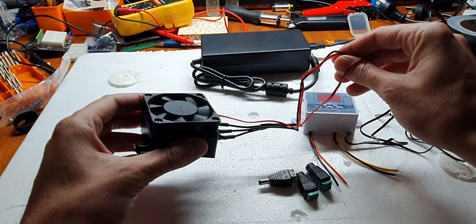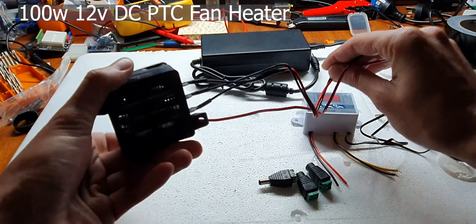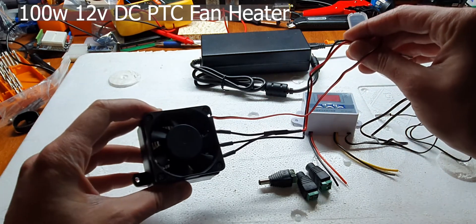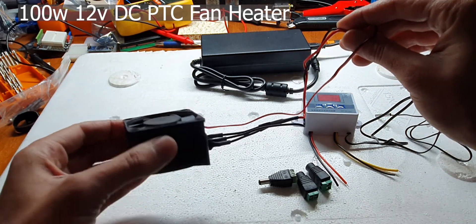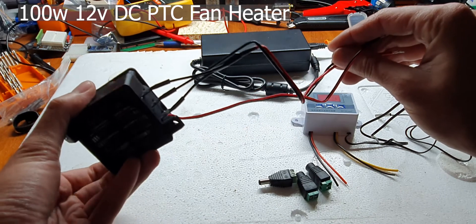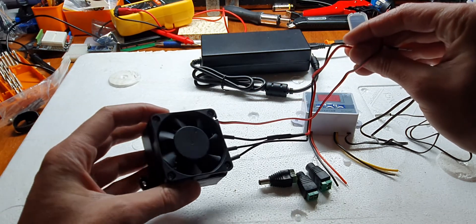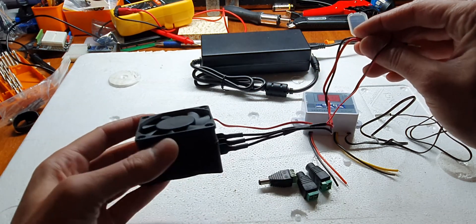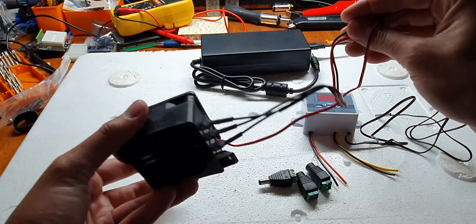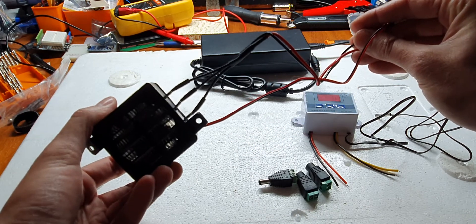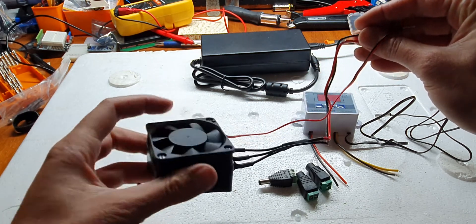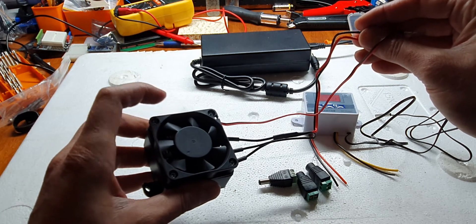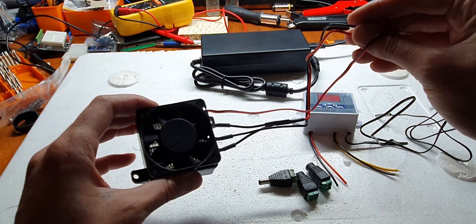Speaking of, we're using a 100 watt PTC fan heater. It has four sets of wires - two for the fan, two for the heater itself made up of two heating elements. The benefit of using this over other heaters like heating pads or mats is that it has a fan which will help distribute the heat around the incubator quite nicely.